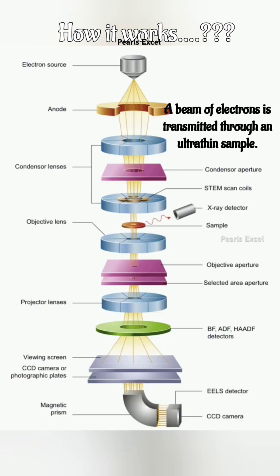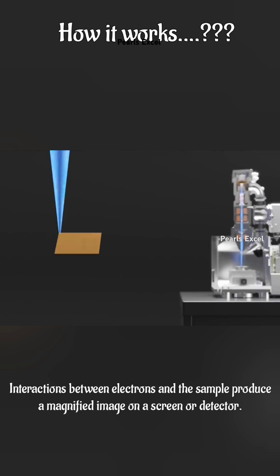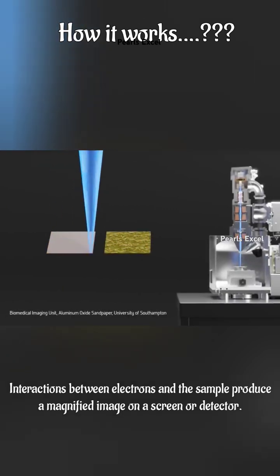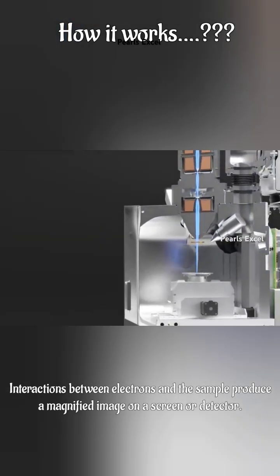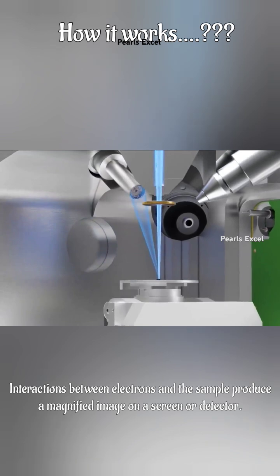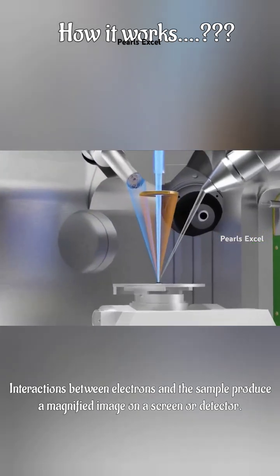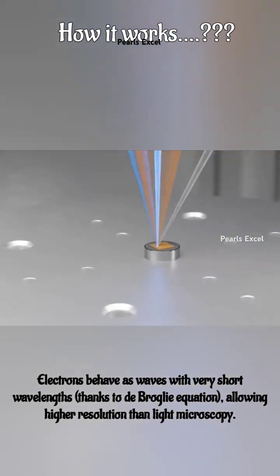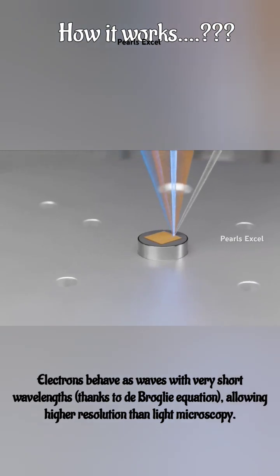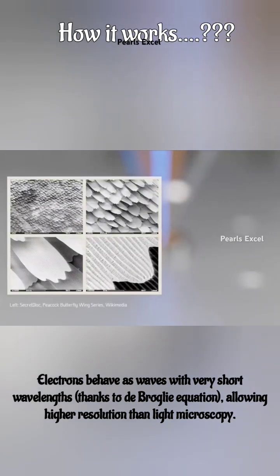Working principle: a beam of electrons is transmitted through an ultrathin sample. Interactions between electrons and the sample produce a magnified image on a screen or detector. Electrons behave as waves with very short wavelengths, thanks to the de Broglie equation, allowing higher resolution than light microscopy.